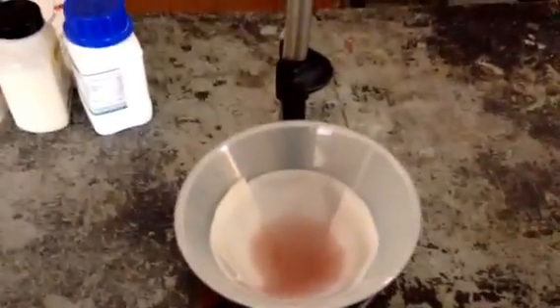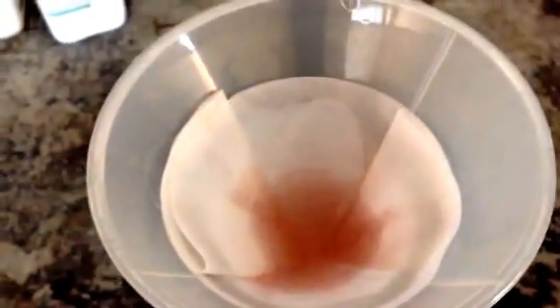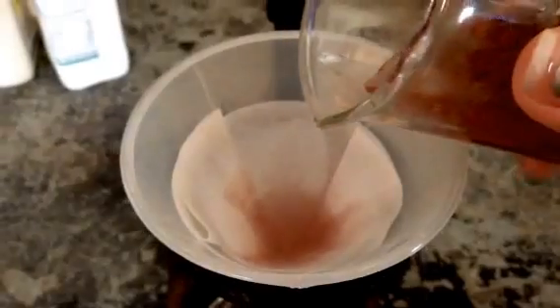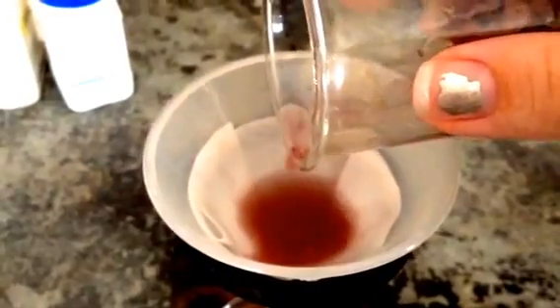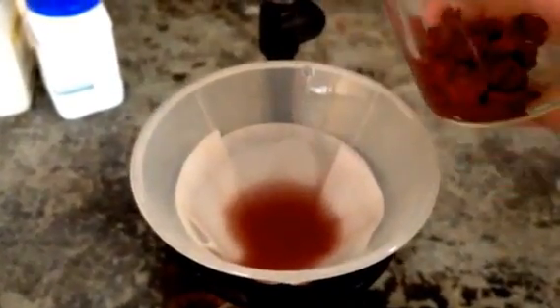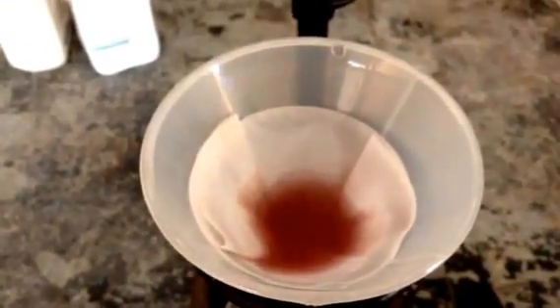As it goes, I'm going to be left with a film. A little bit hard to see right now, but I'm having no liquid in there and I've got that red stuff — I'm getting the solid out. So I'm going to pour again. Do you see down at the bottom? The liquid is collecting in the other beaker.